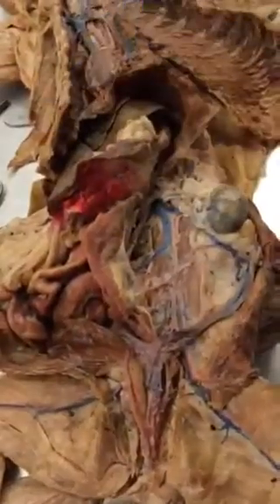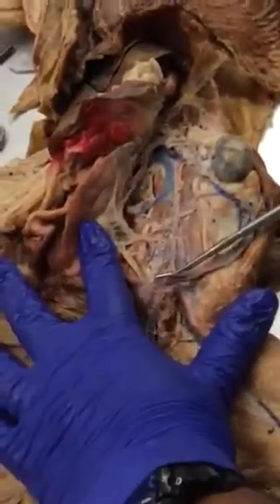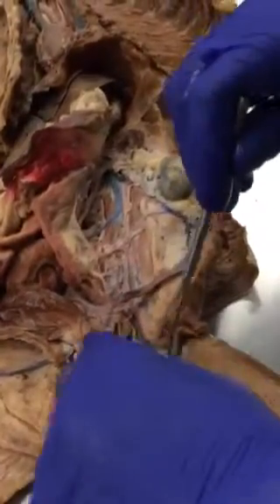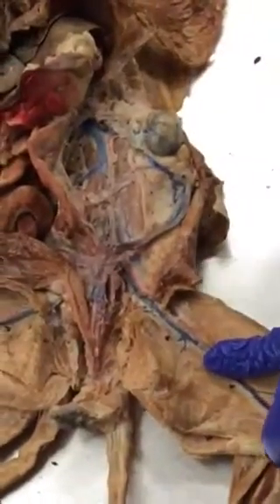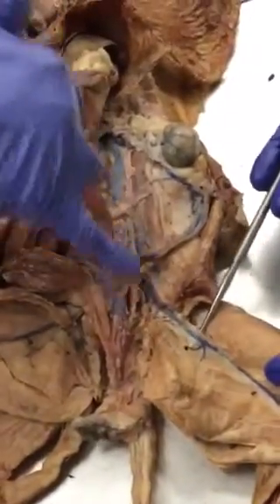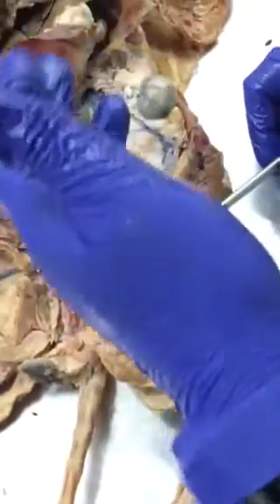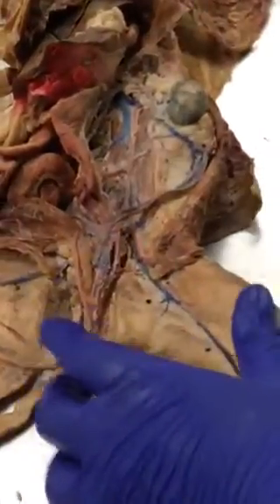The dorsal aorta goes down and makes a fork — the lateral branches going into the legs are called the external iliac arteries. The external iliac artery continues into the thigh region where it is called the femoral artery. If a pin is placed in the thigh region on the artery, that's the femoral artery; if it is after the branching but before the thigh, near the iliac region, that's the external iliac.